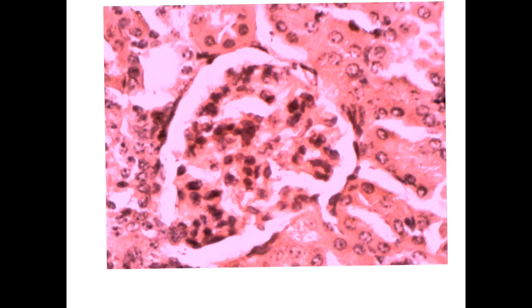This is the Malpighian renal corpuscle, characterized by the appearance of this tuft of capillaries that is surrounded by the space here, empty space, to receive the glomerular filtrate. And then we have the parietal layer of the Bowman's capsule lined by simple squamous. The most important thing is to look for the surrounding structures. The surrounding structures appear as tubules. Everything around it is tubules with lumen.